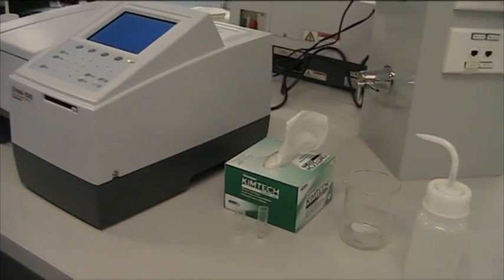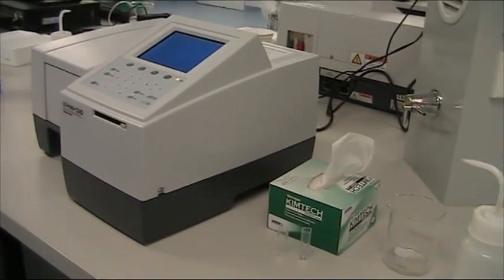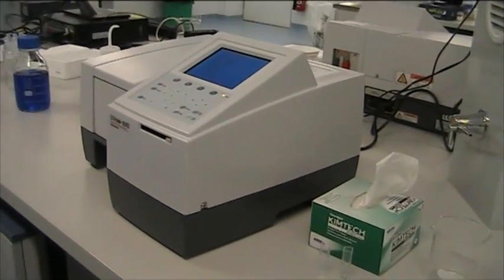You will need a wash bottle containing deionized water, a beaker to hold liquid waste, a box of laboratory tissues, and cuvettes.